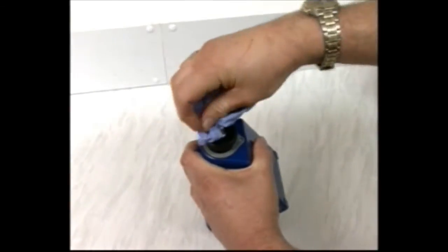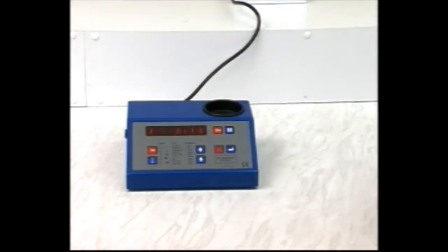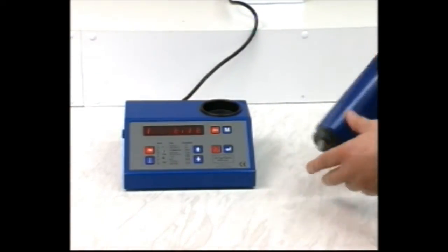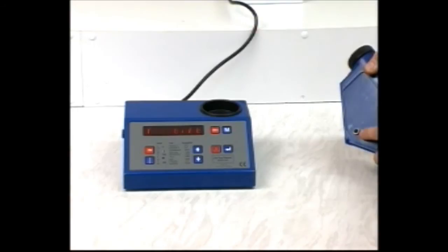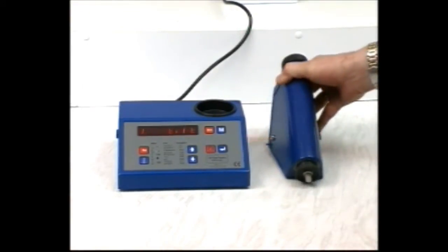Place the viscometer about 4 inches away from the main unit with the power reset button facing out. It is important to keep the infrared link roughly in line.